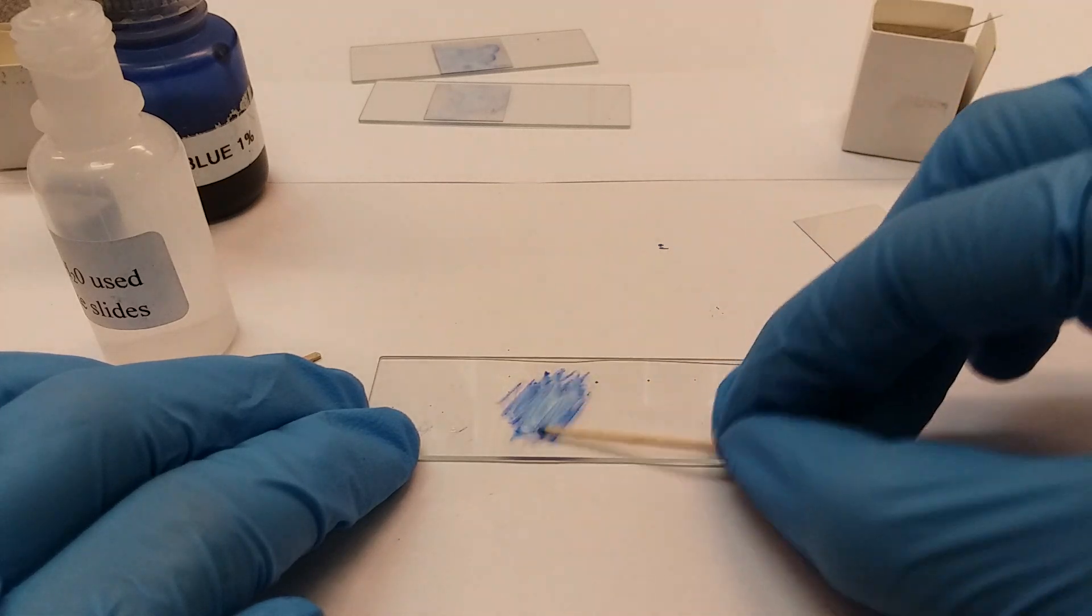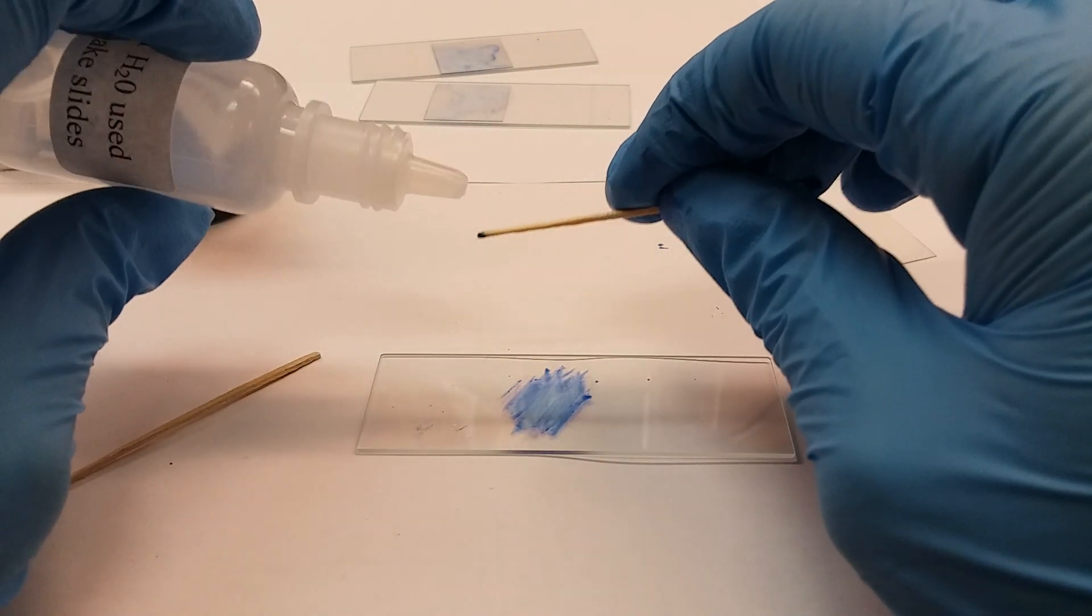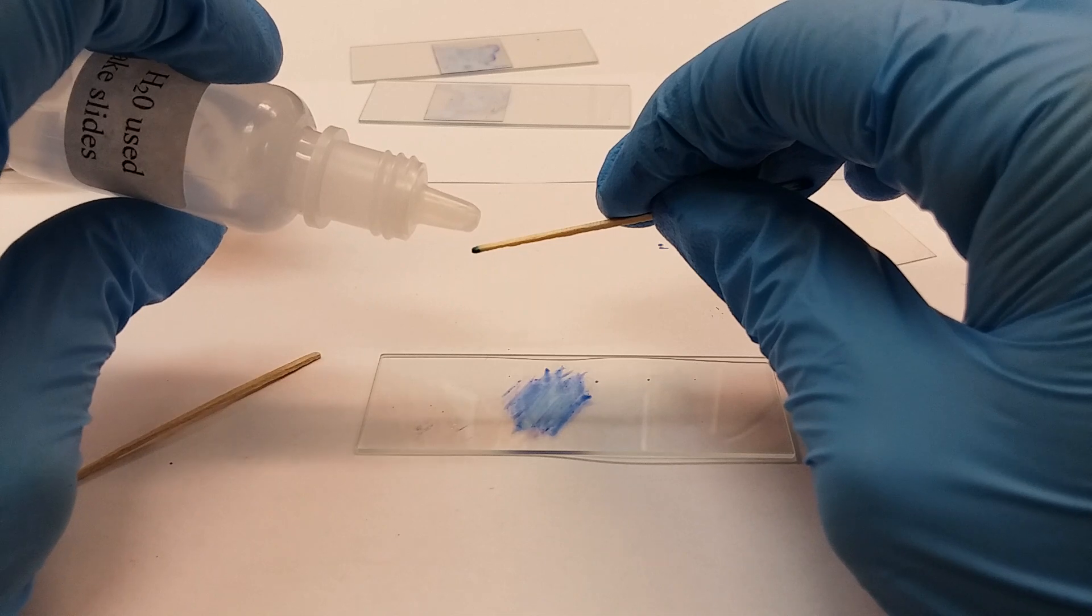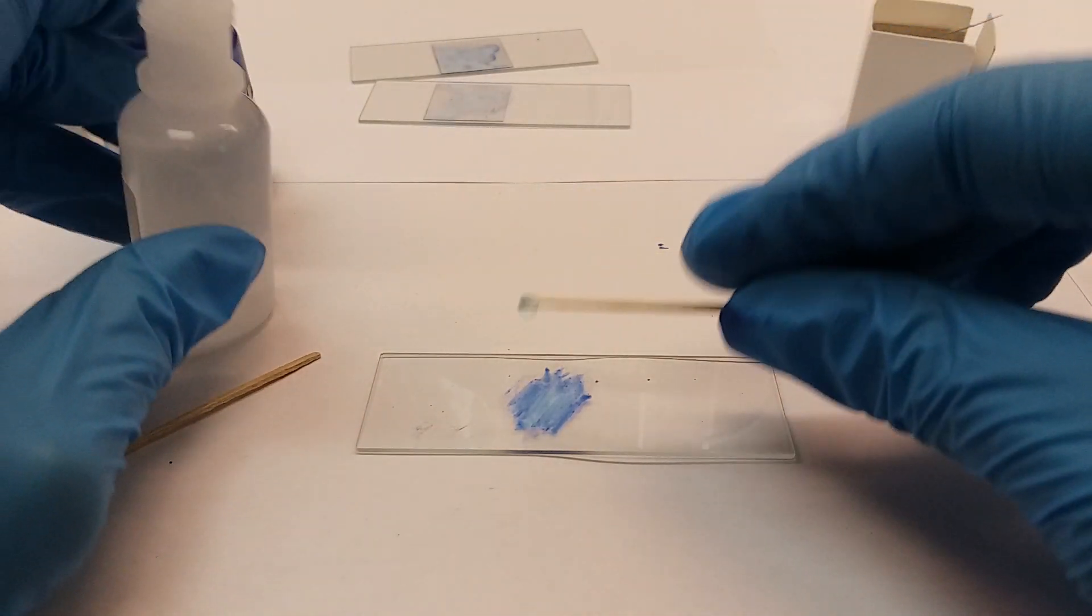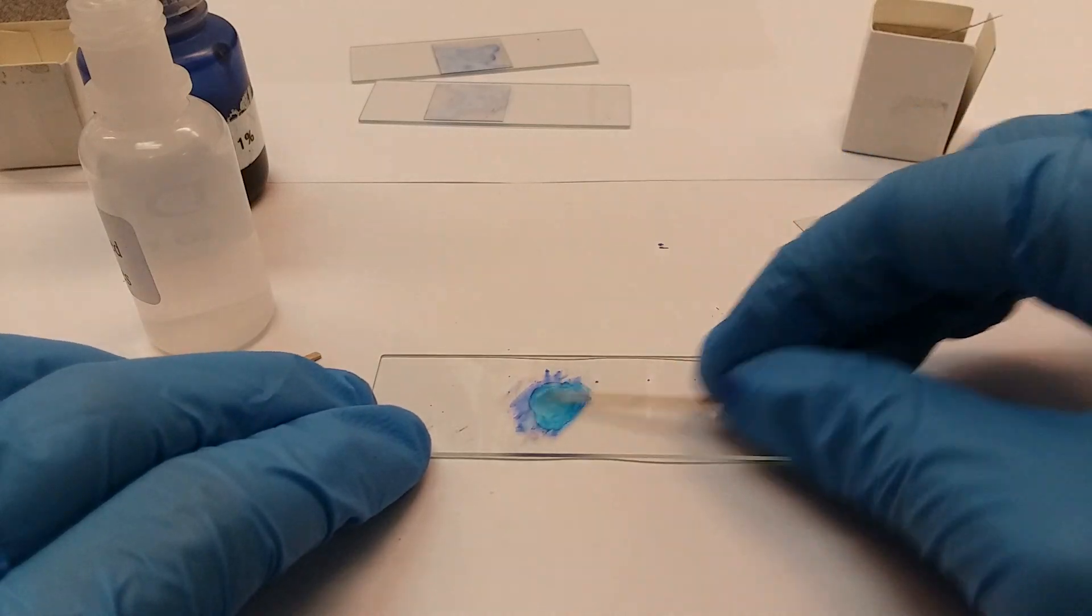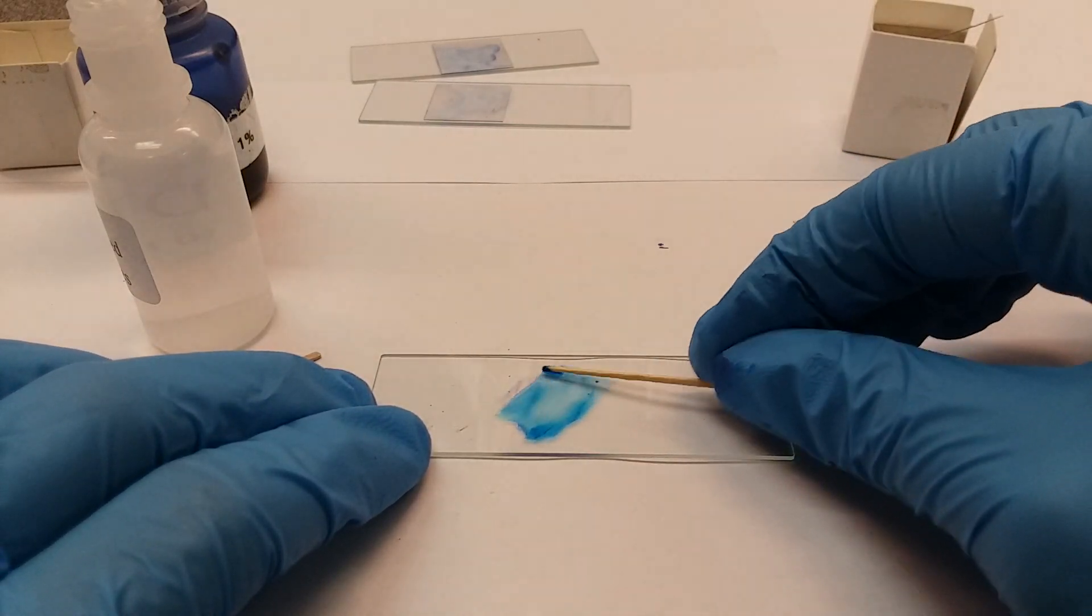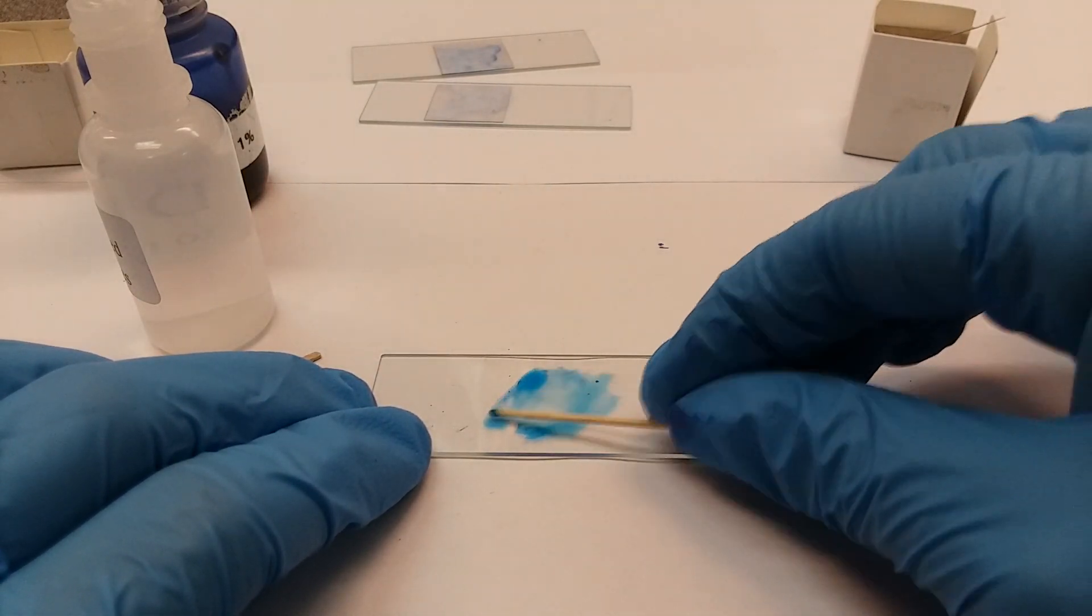I'm going to drop it on here. Guess what, you have a lot of slides in your little container, so you can make as many as you want. That's just your cheeks that you're going to be rubbing on.